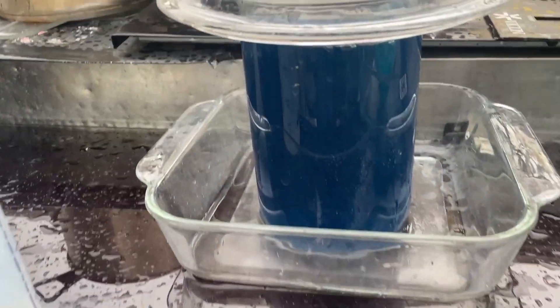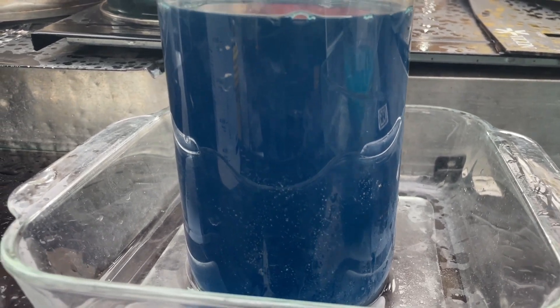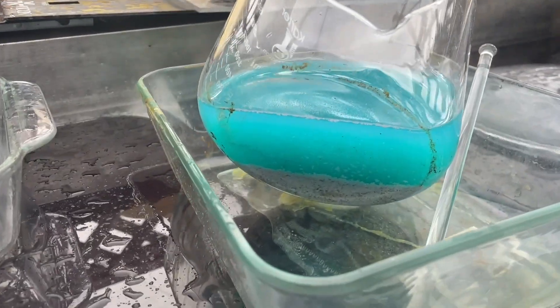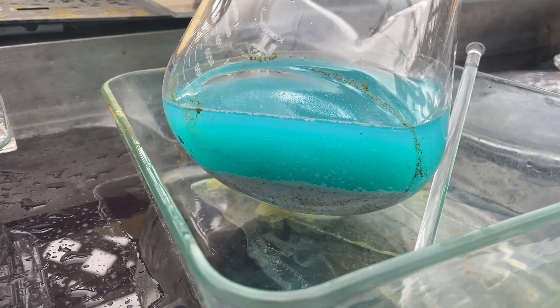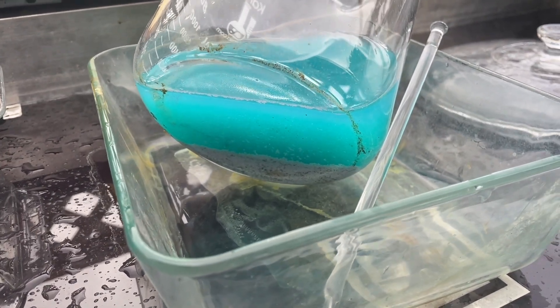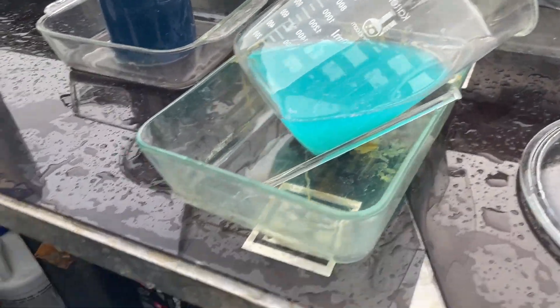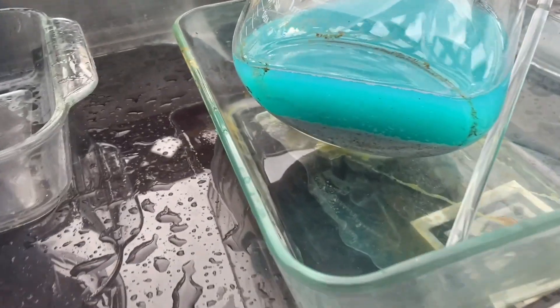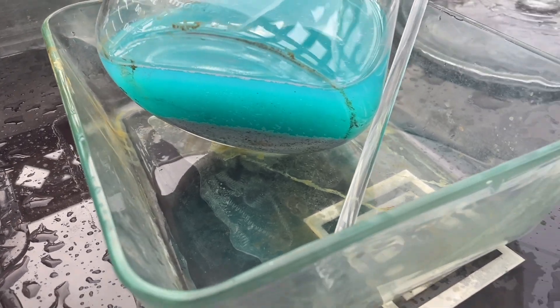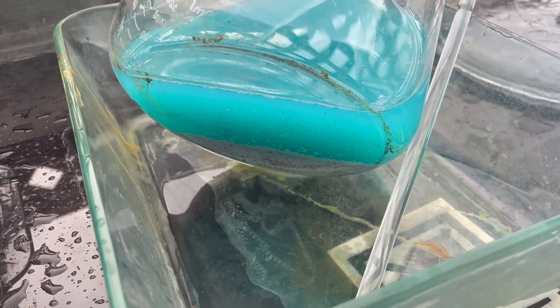Here I have some silver nitrate solution, and here I have a little bit of silver nitrate which I added a little bit of hydrochloric acid to. You can see in the bottom there we got a whole bunch of silver chloride. Once that settles for a few more minutes, I'm gonna pour that solution off, wash it a few times, convert it to an oxide with some lye, and then to silver metal with some sugar.